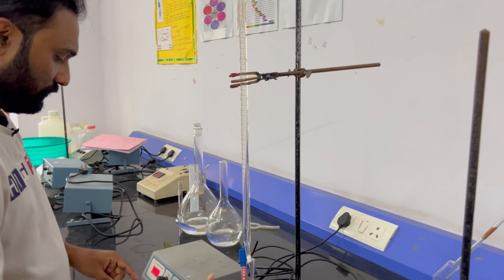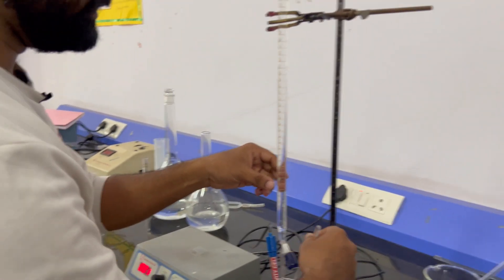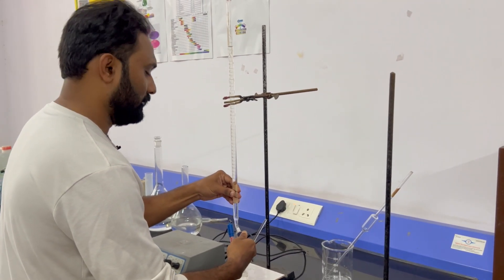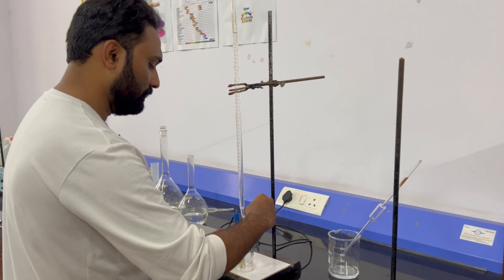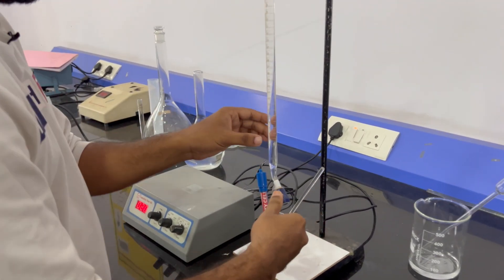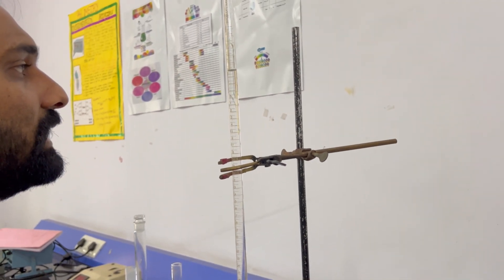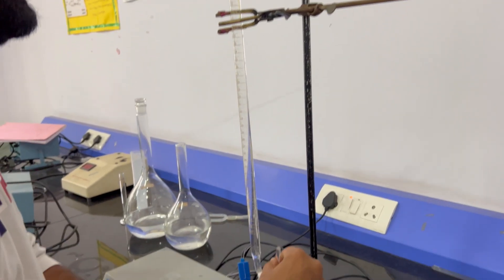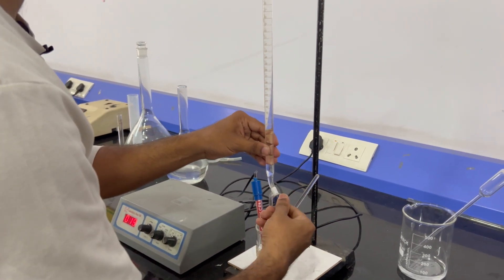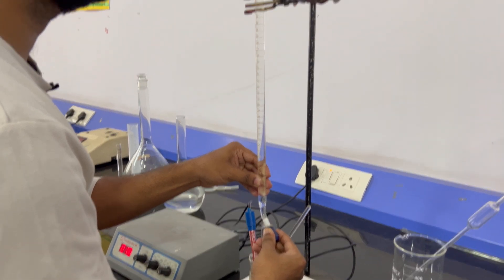Now we can see the conductivity is going to be decreased. Getting another reading here — I was adding until it reaches the end point. Till it reaches to the end point.